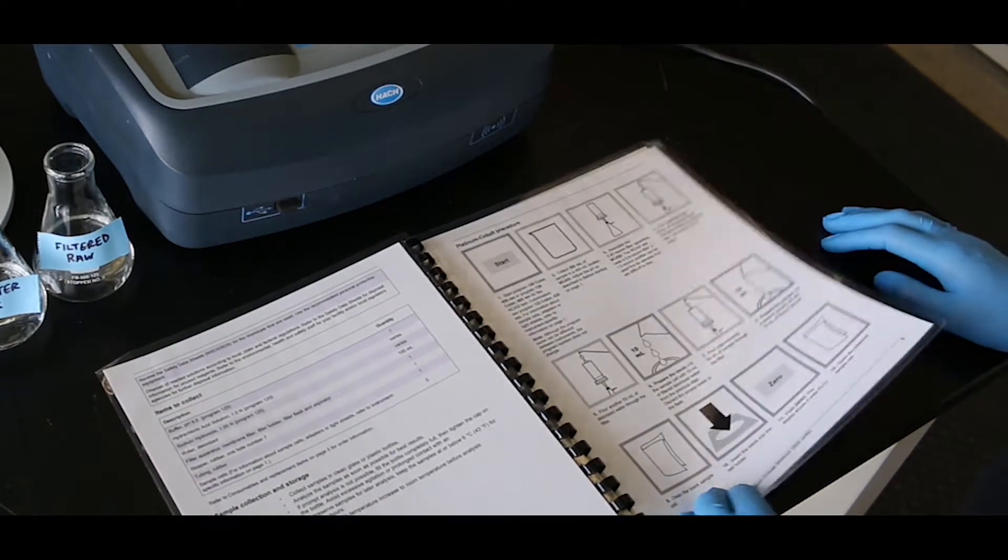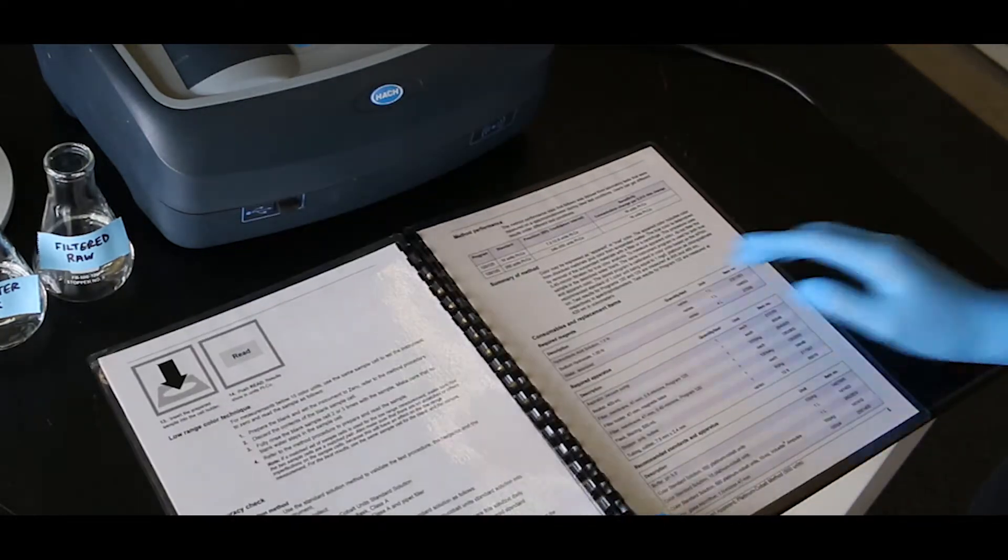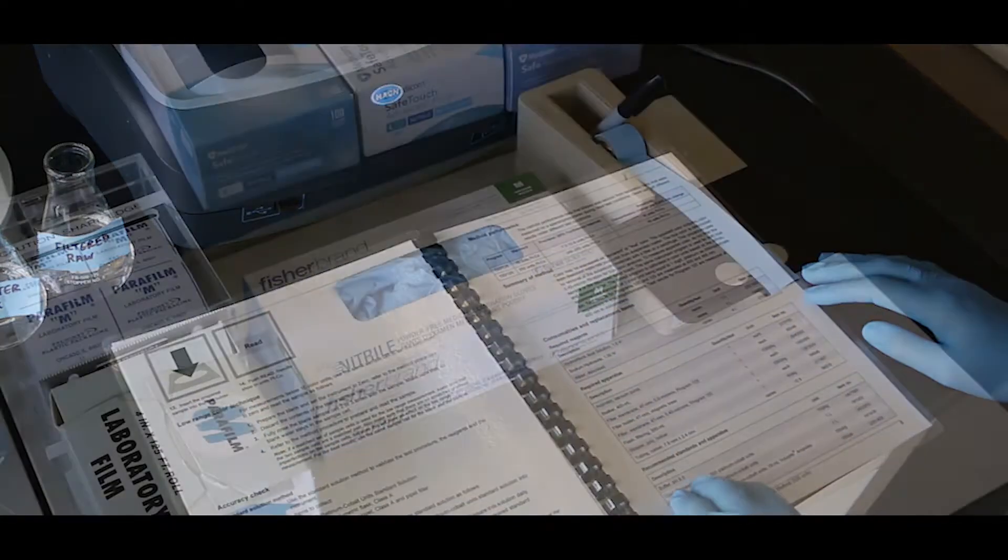This is a basic overview. You should always refer to the methods and procedures specifically provided for your equipment.